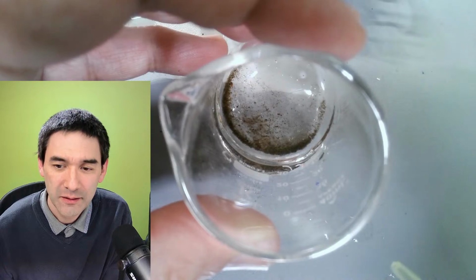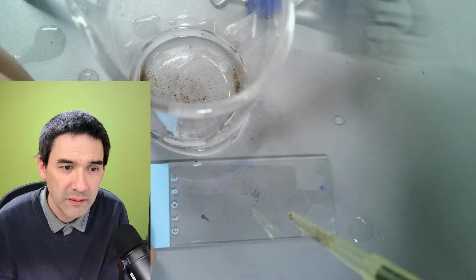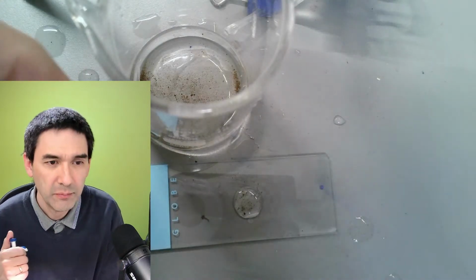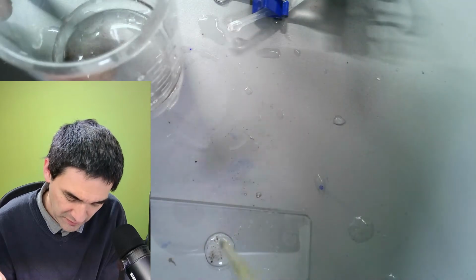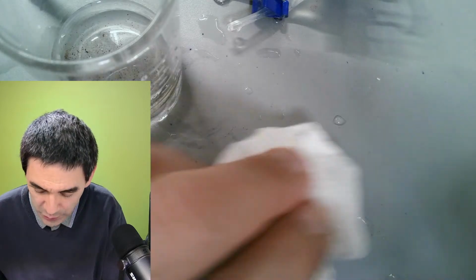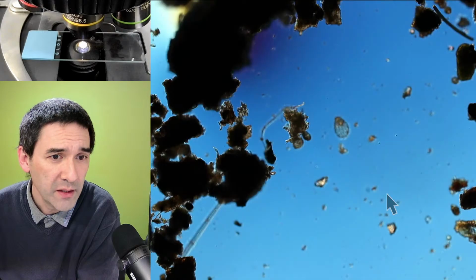We're going to wait until everything settles down, and then I quickly take up some of this material. Then I wait until it settles down in the pipette a little bit, and then you can, but that's not very much really, so I'm going to try it again. You want to spread it apart a little bit, and then I'm going to put it, without a cover glass, on the microscope slide and on the microscope stage rather, and I'm going to change over right away. So that is the one from before.